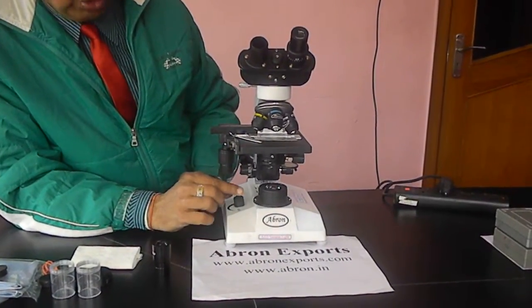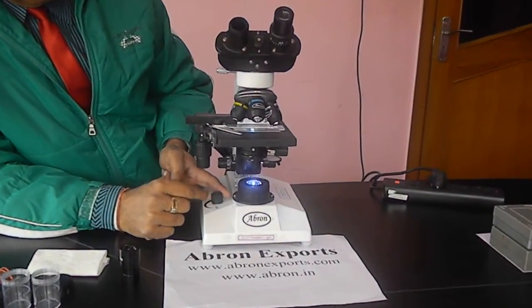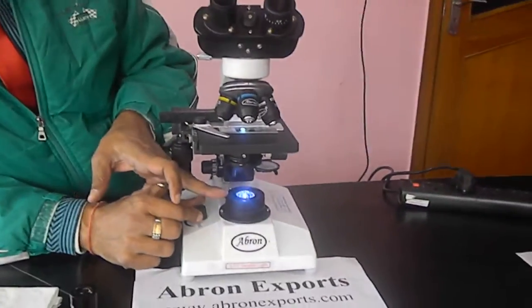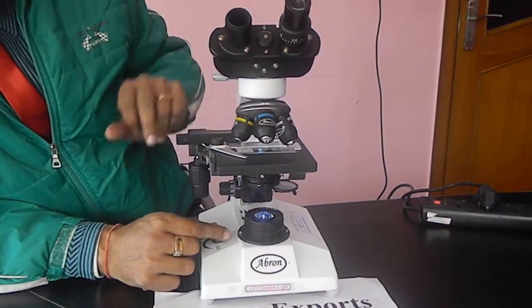This is the LED microscope which is a binocular one. There is one button with variable light which can increase or decrease the light. You can see the light is increasing or decreasing.